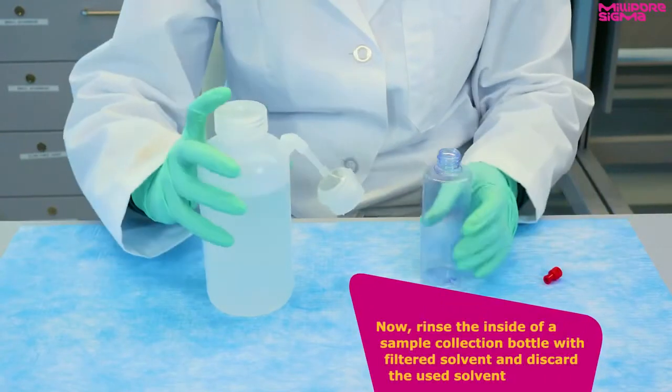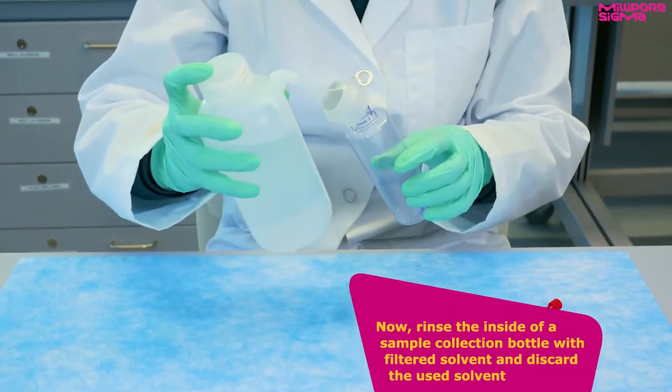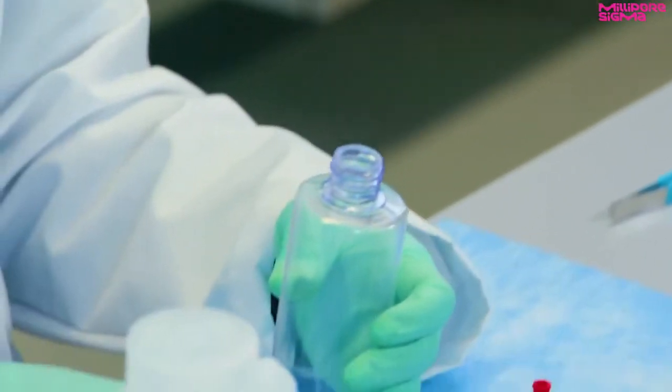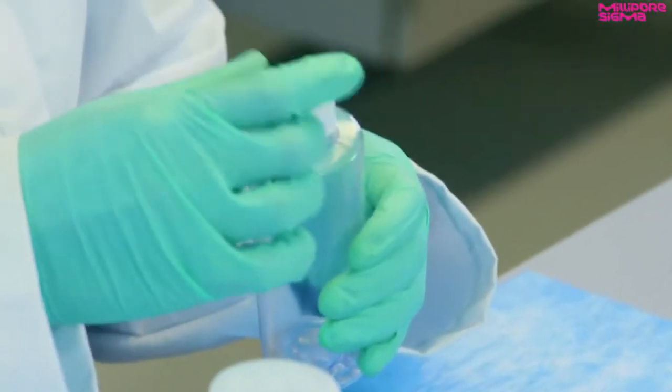Now rinse the inside of a sample collection bottle with filtered solvent and discard the used solvent. Fill the sample collection bottle to the shoulder point with the test fluid and cap securely.